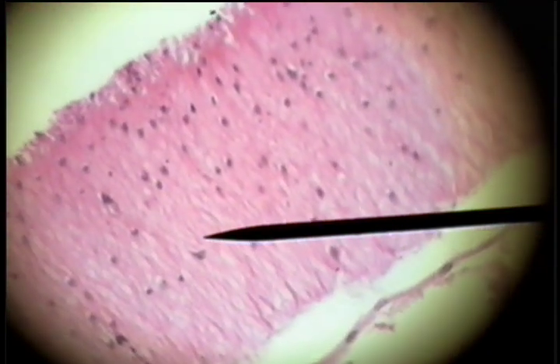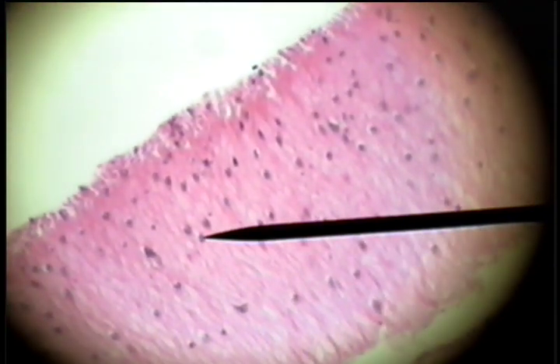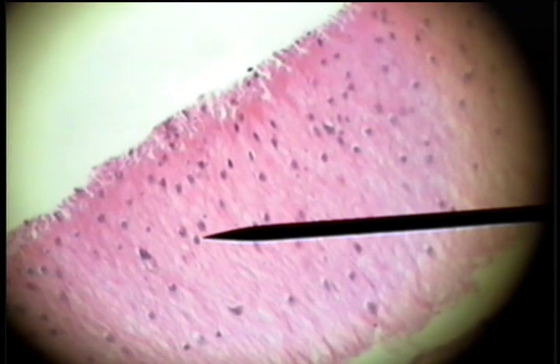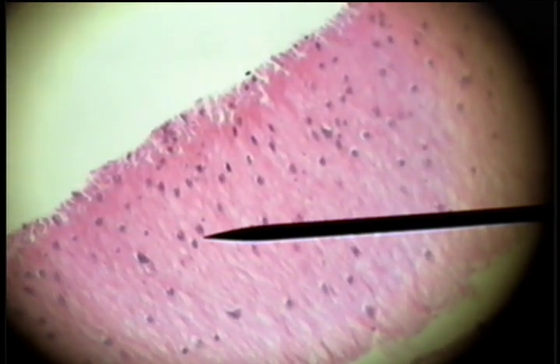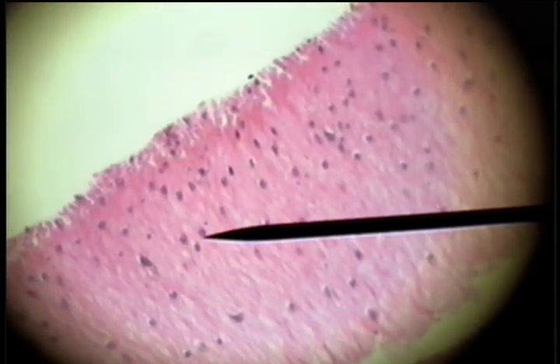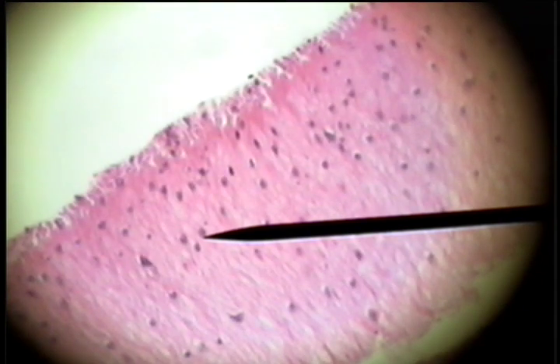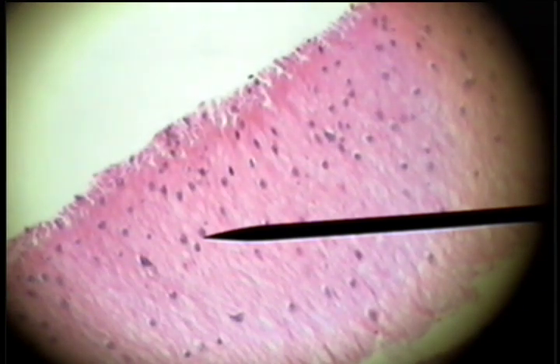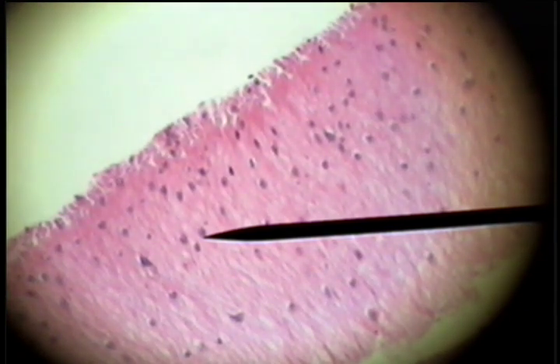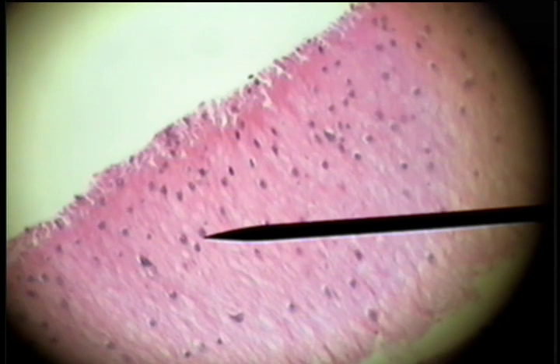This is a cross section of smooth muscle where the nuclei of the individual small cells, pointed at both ends, show as a black dot in the center of the cytoplasm.